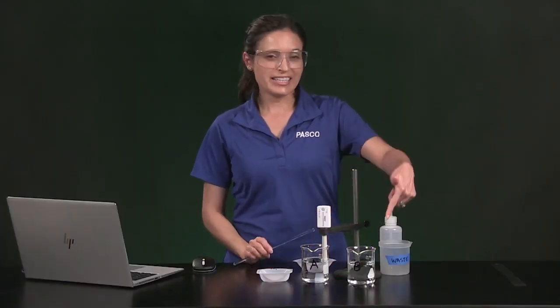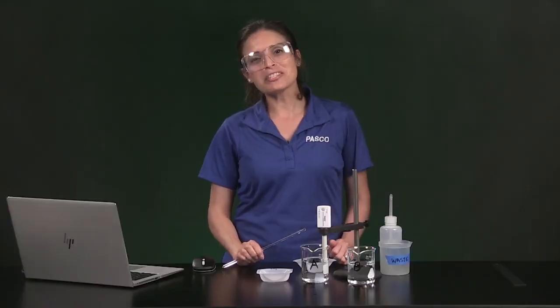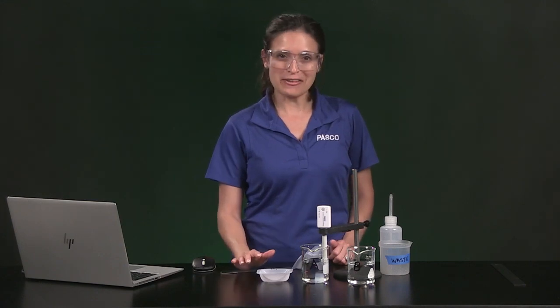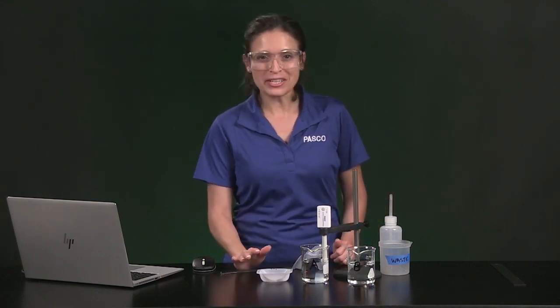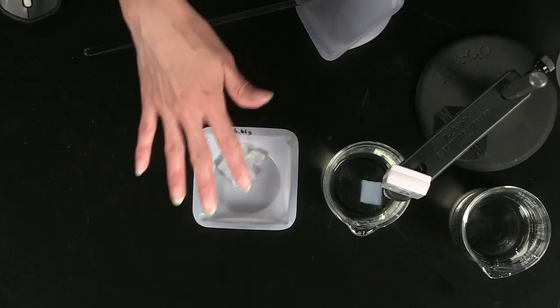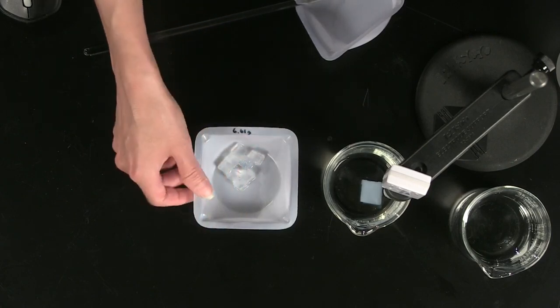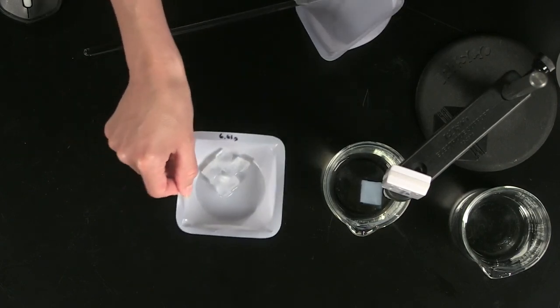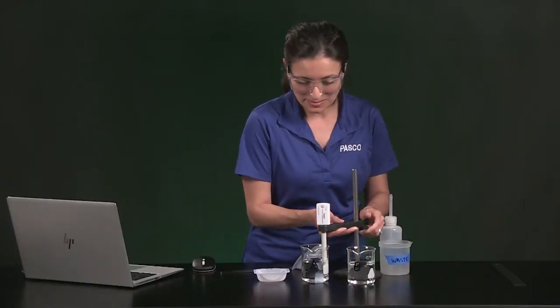Now I'll use Beaker B and the small cubes to see if cube surface area makes a difference in the rate at which salt leaves the gel. I've got the same amount of stuff as the first run. Mass and volume are the same, but we've changed the total surface area as well as the individual cube surface area to volume ratio. Let me set up the next system.